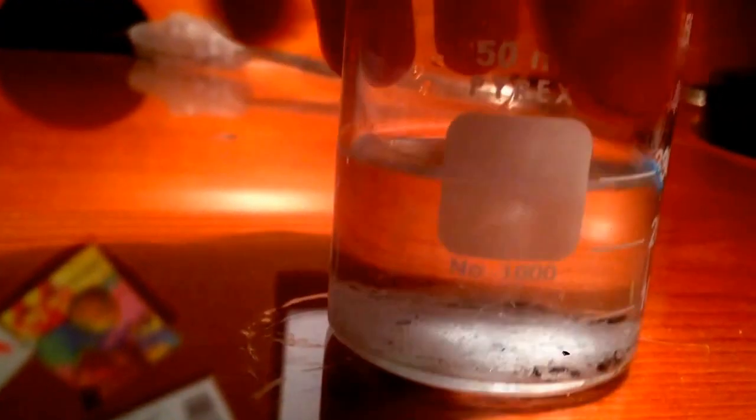After rolling it up, you can see all that is left is the copper metal, and I simply decanted the fluid. Some copper metal seeped through during decanting, so I decided to put it back in the beaker and stack a few tissue papers on top of each other to filter it instead. Here you can see the copper metal is left on the filter paper while the solution drips down.